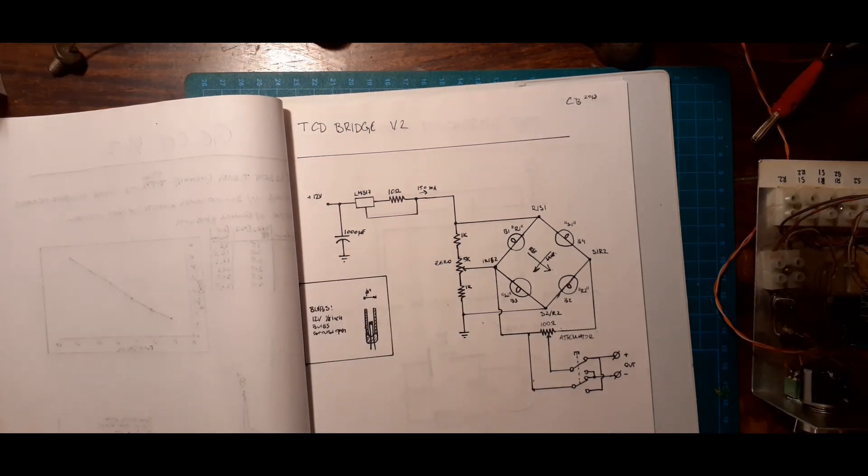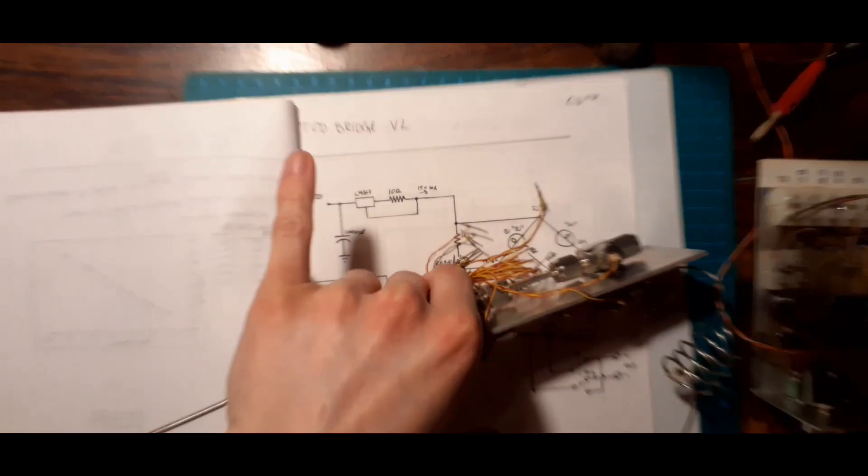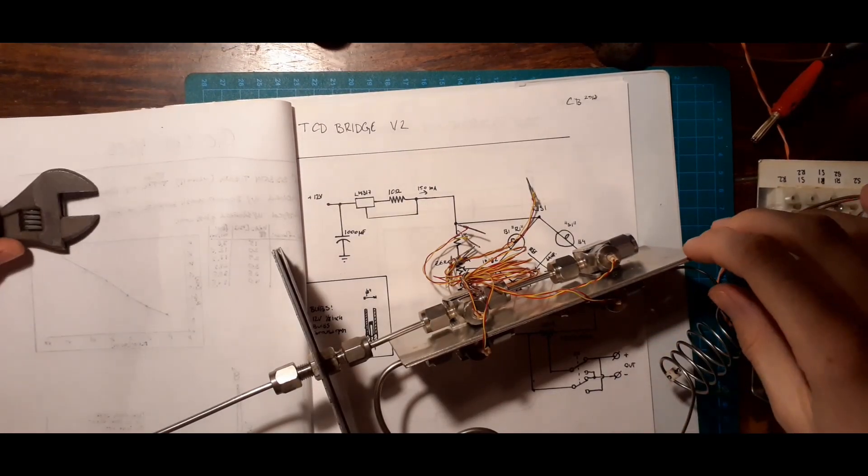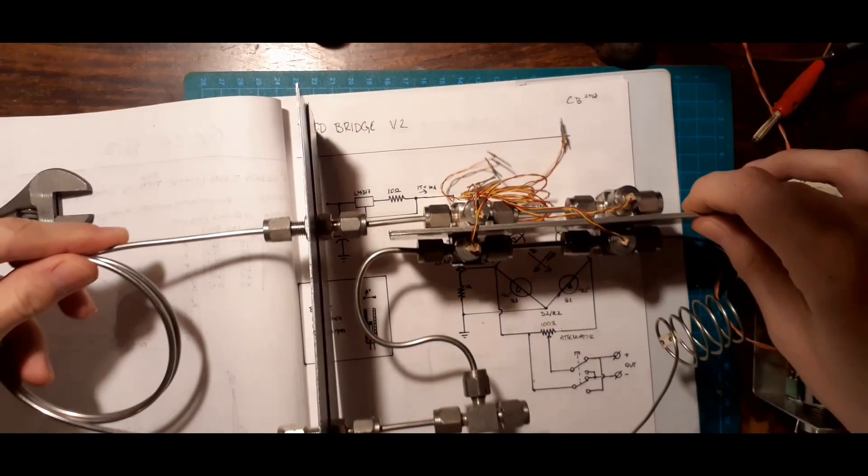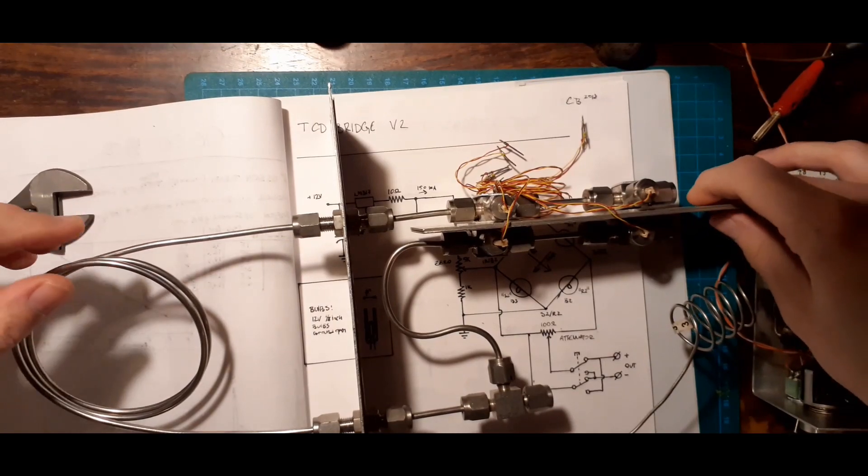Let me show you how I actually built this, because it's actually fairly tricky. So this is what I was talking about. You've seen this before, it's disassembled because I was bringing it to a job interview.